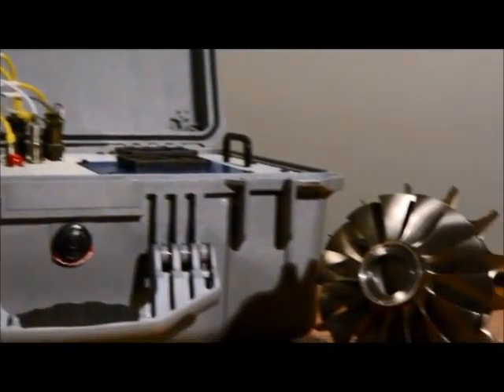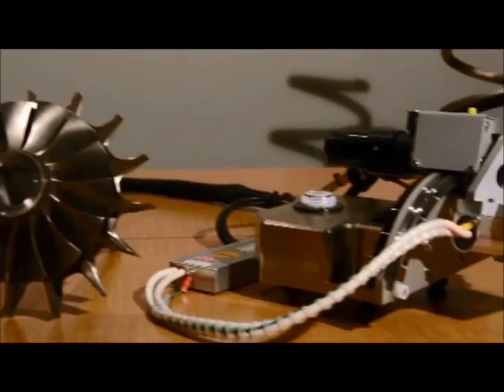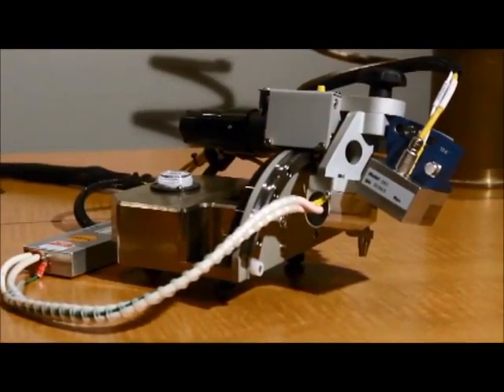Hello, I'm Beth Matlock, Senior Materials Engineer for TEC's Material Testing Division. Our Materials Testing Division offers state-of-the-art portable diffractometers to measure residual stress and retained austenite. Residual stress is the stress that remains in your part after all external loads are removed. It is developed during the manufacturing process and during service history.